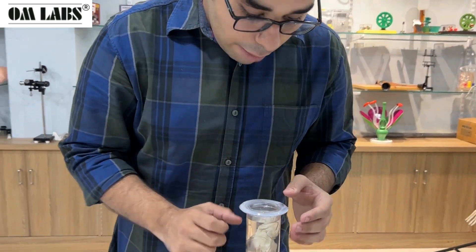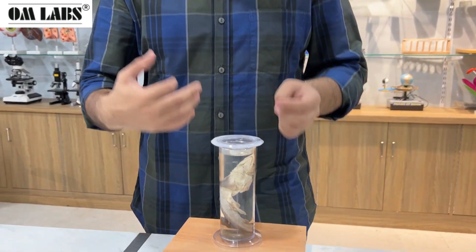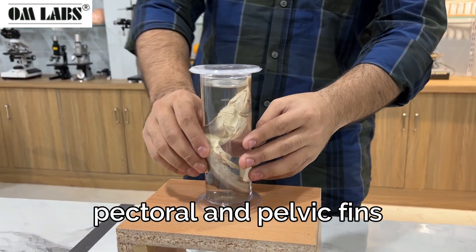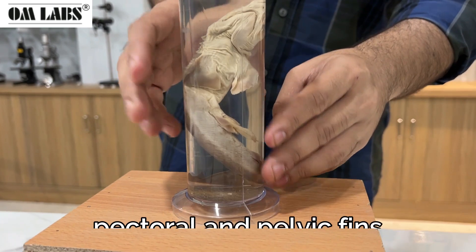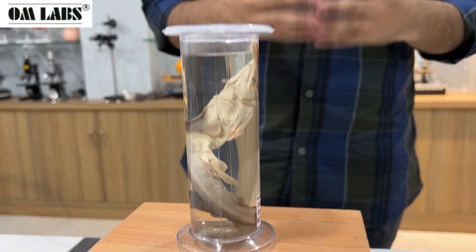Then we have our fins here — pectoral fins and pelvic fins, which you are seeing here, used for locomotion.